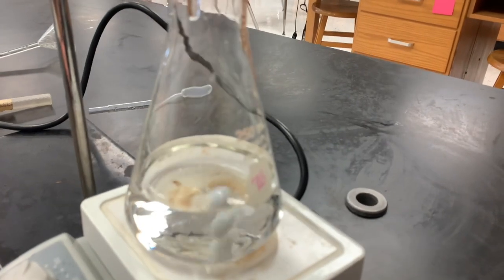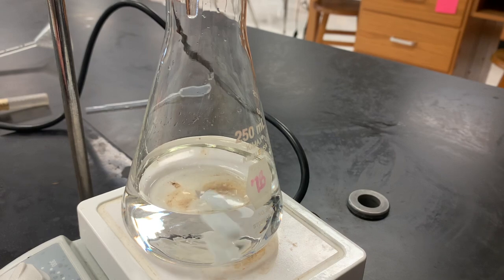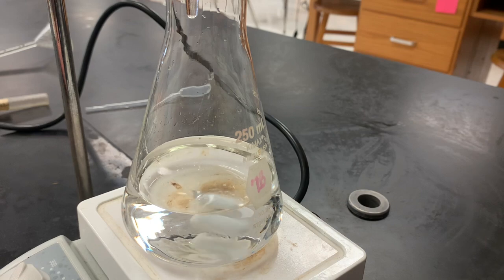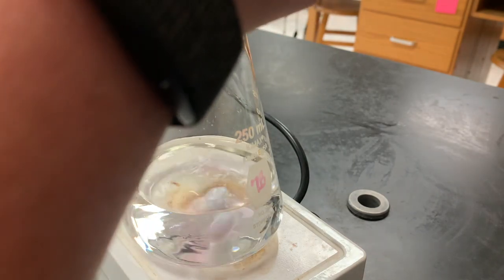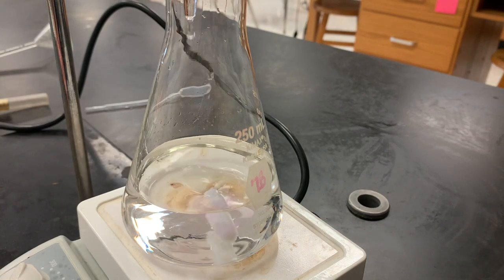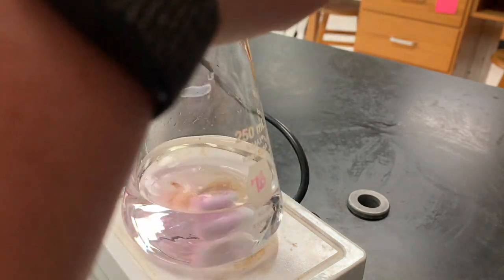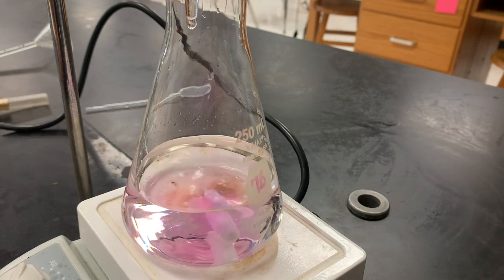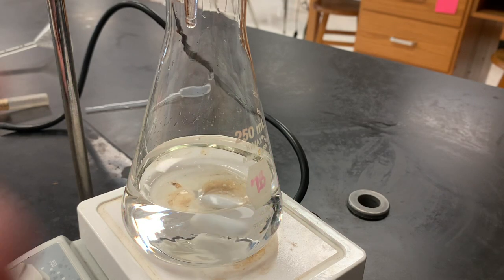Now that you know what's happening with the burette, I'm actually going to get you closer so you can see a more efficient color change. We already started to see a color change, so I need this going in drip by drip, because I want it to be the lightest pink possible for at least a minute. That is when we know we've hit the neutralization point — the titration point — which is what we're looking for. What we're doing right now is a neutralization reaction via a titration. You can see the pink is showing up in the solution, but it's not staying. We need to add NaOH until it starts to stay. This is why you have to spin it constantly — see how as it spins, it disappears? That means we have not quite gotten there yet, but we're getting close.